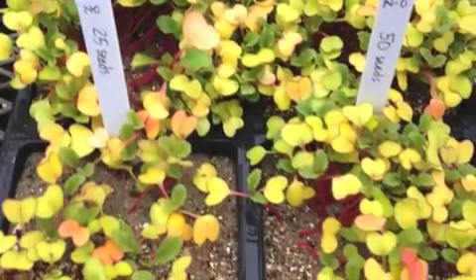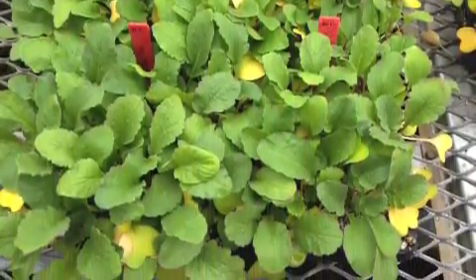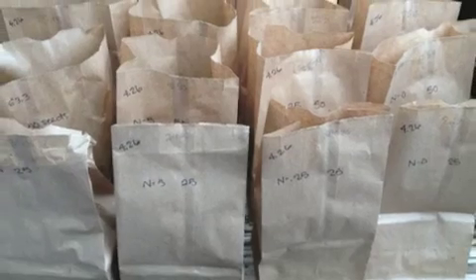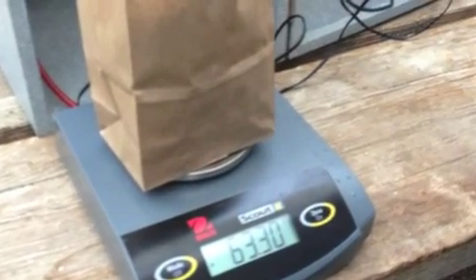After 4 weeks in a controlled greenhouse environment, we observed and recorded the health and size of the seedlings in the pots. We clipped the plants' shoots and placed them in a paper bag. Bags were labeled by the sample's seeding density and fertilization treatment. We then weighed and recorded masses of shoots only.